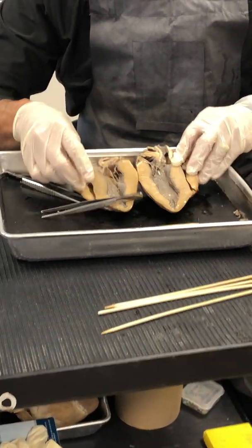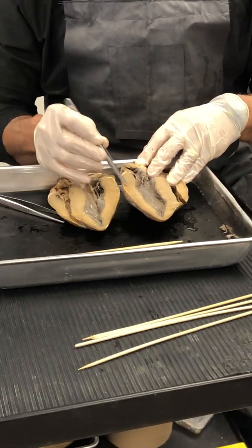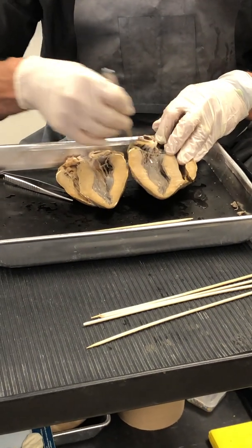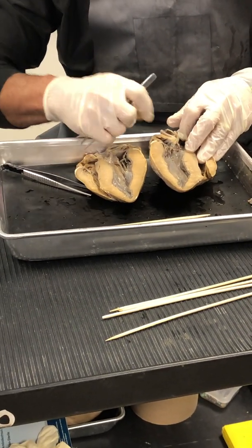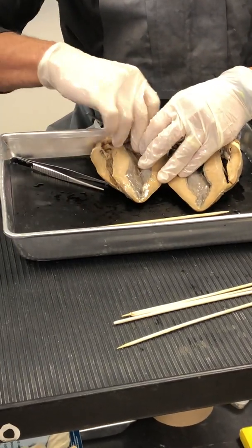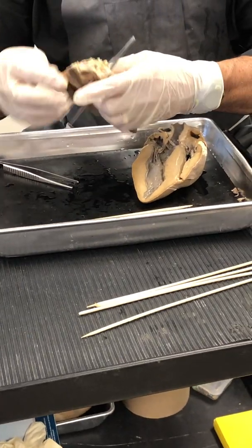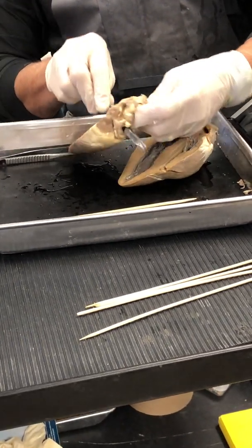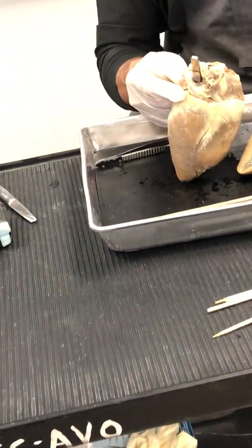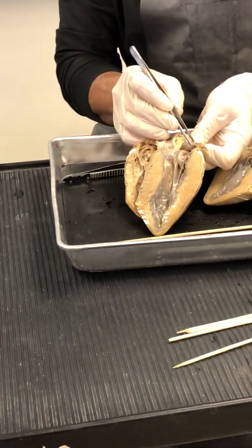So now we put things here, and what are we seeing? There's the left-hand side. Thicker, thinner. So there's my left ventricle, and there's my left atrium right there. So again, I prod and I poke. There's no hole here. But I come over here, and there, it slides right through. So there is where the pulmonary vein would be. The pulmonary veins come from the lungs into the left atrium right there.